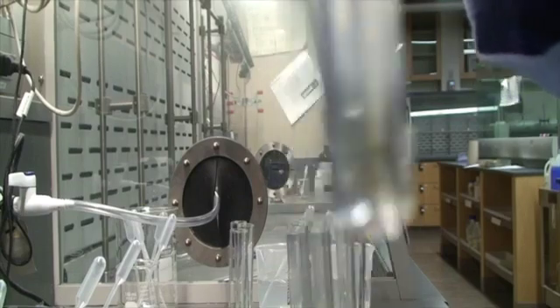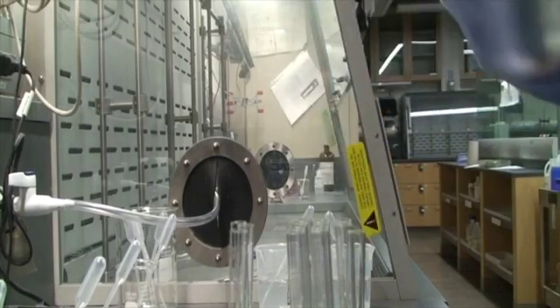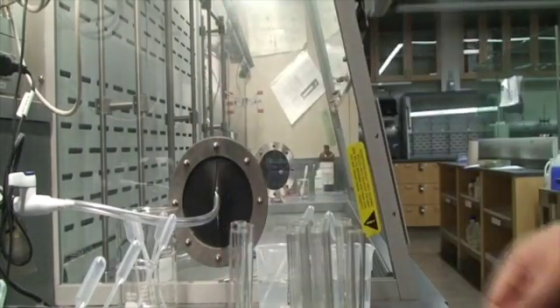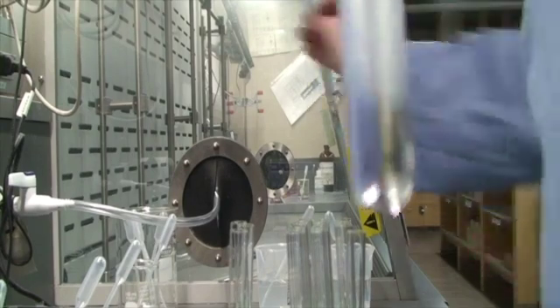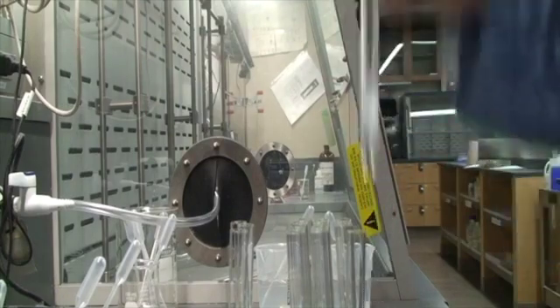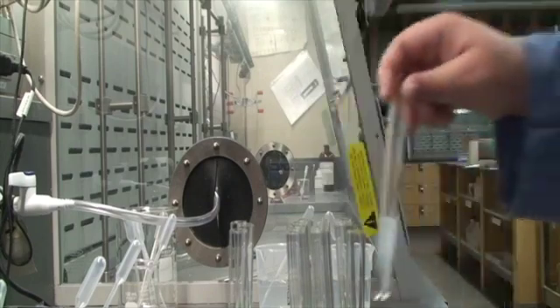Very, very slight. Or maybe almost like nothing at all. Did it make heat? Nope, feels pretty cool. There was no bubbling. Let's see if it's smelly. Not smelly. Alright, so that was 8 plus 10. I would say no reaction, extremely slight precipitate. Almost looks like some sort of contamination.